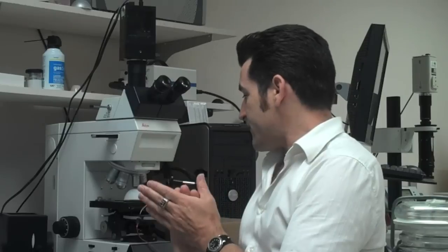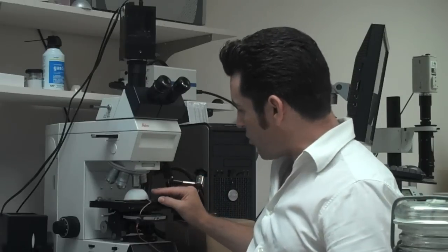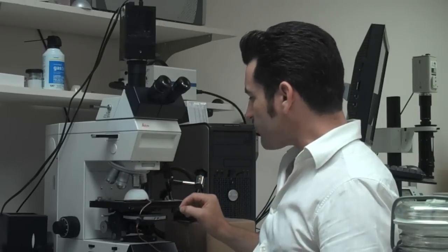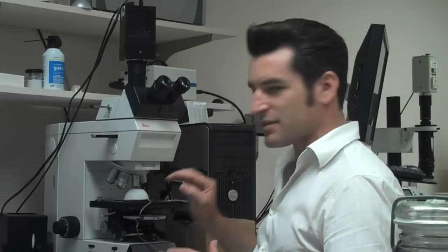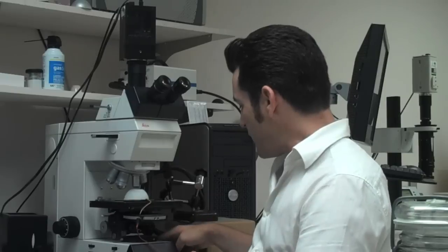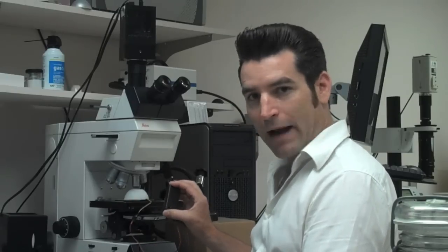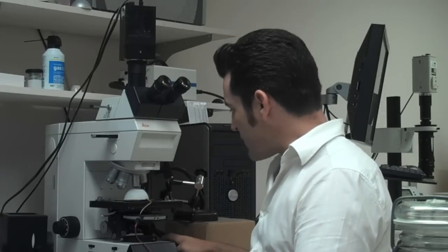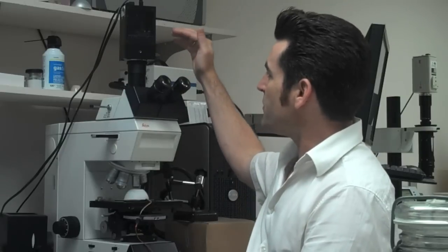The other innovation is this tiny little white dome you see here. It's just like the LED dome we used on the other system, except here there's only 20 LEDs, high intensity. They're DC powered with a 9 volt battery.